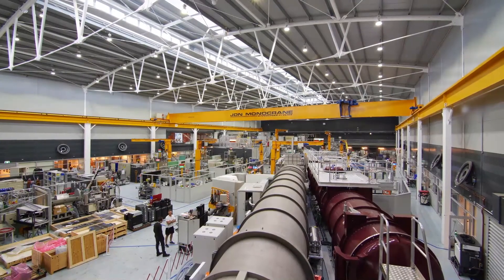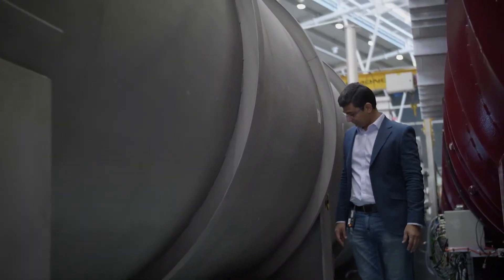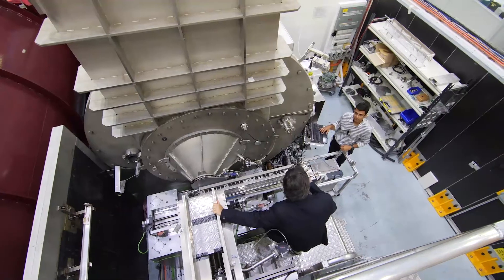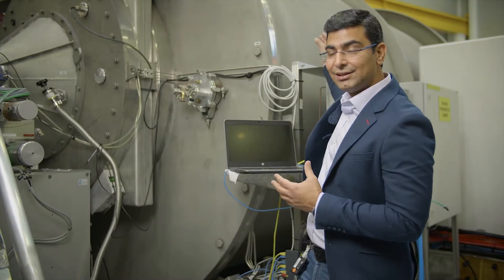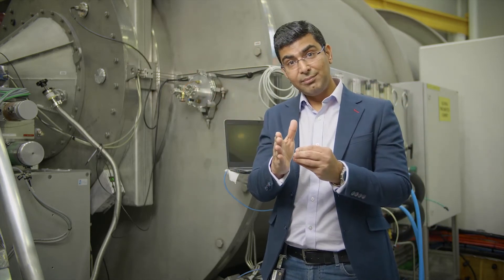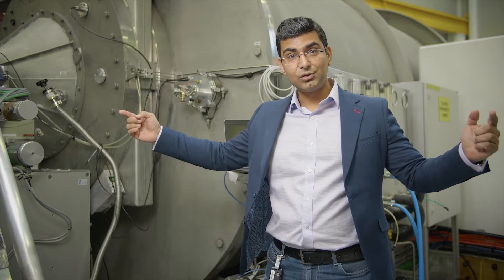So let's talk about QUOKKA. QUOKKA is the longest instrument in the guide hall — it's a 40-meter long instrument. It starts from the velocity selector, up to the sample position, and then from the sample position to the detector. The detector moves in this big tank. It can be as close as 1.3 meters or it can move up to 20 meters, making it a 40-meter long instrument.